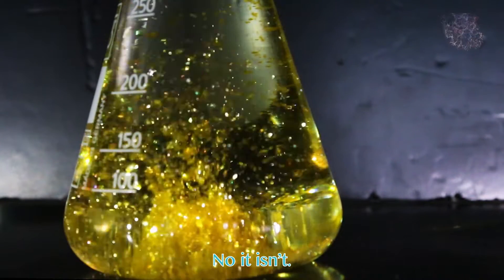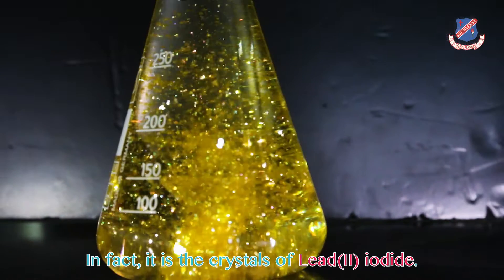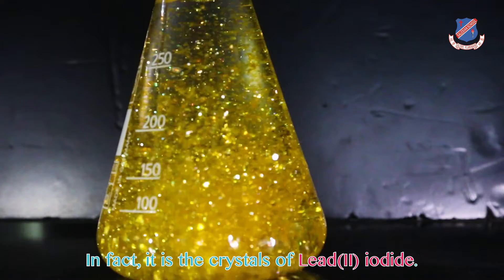Is that gold? No, it isn't. In fact, it is a crystal of lead(II) iodide.